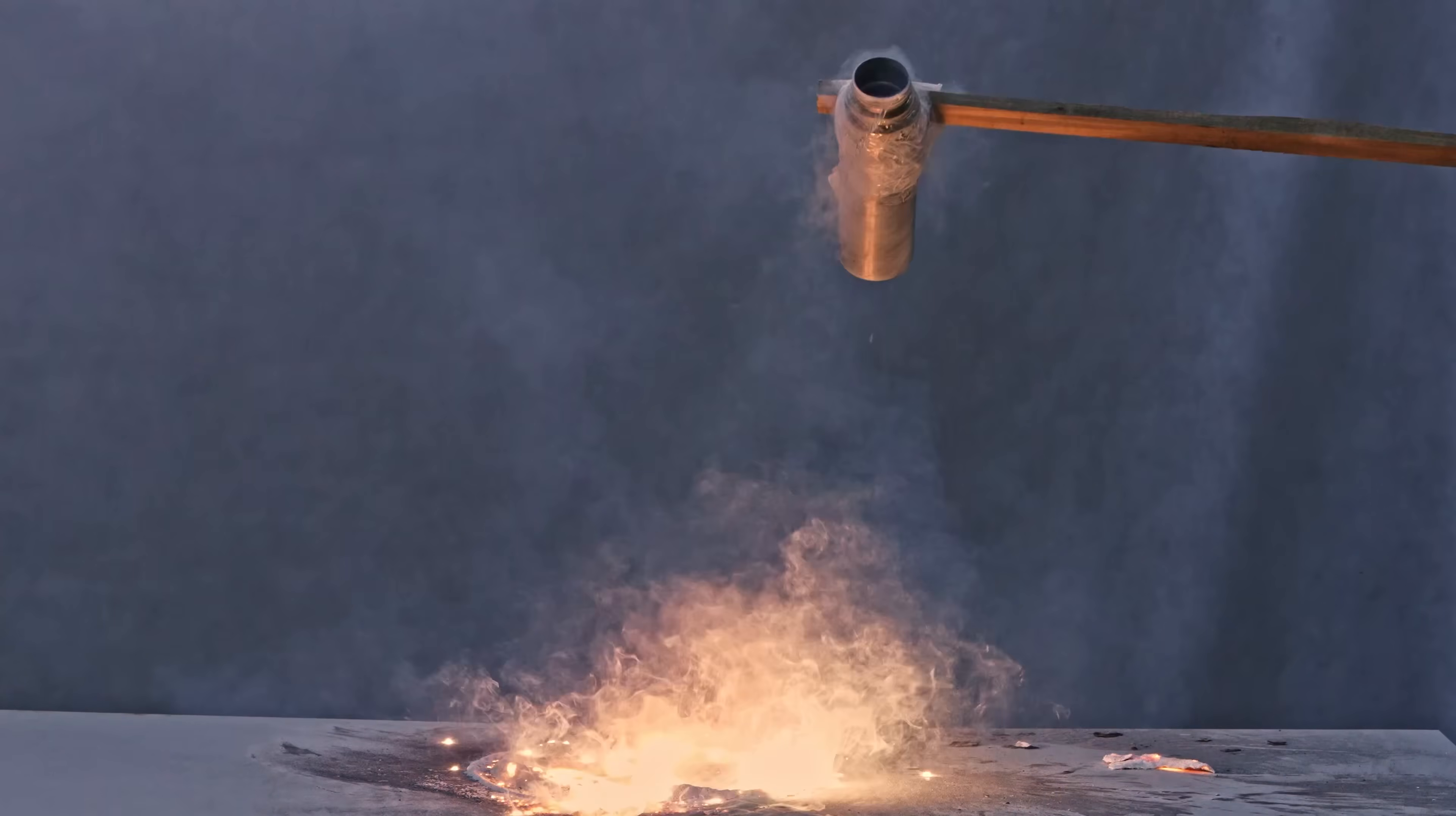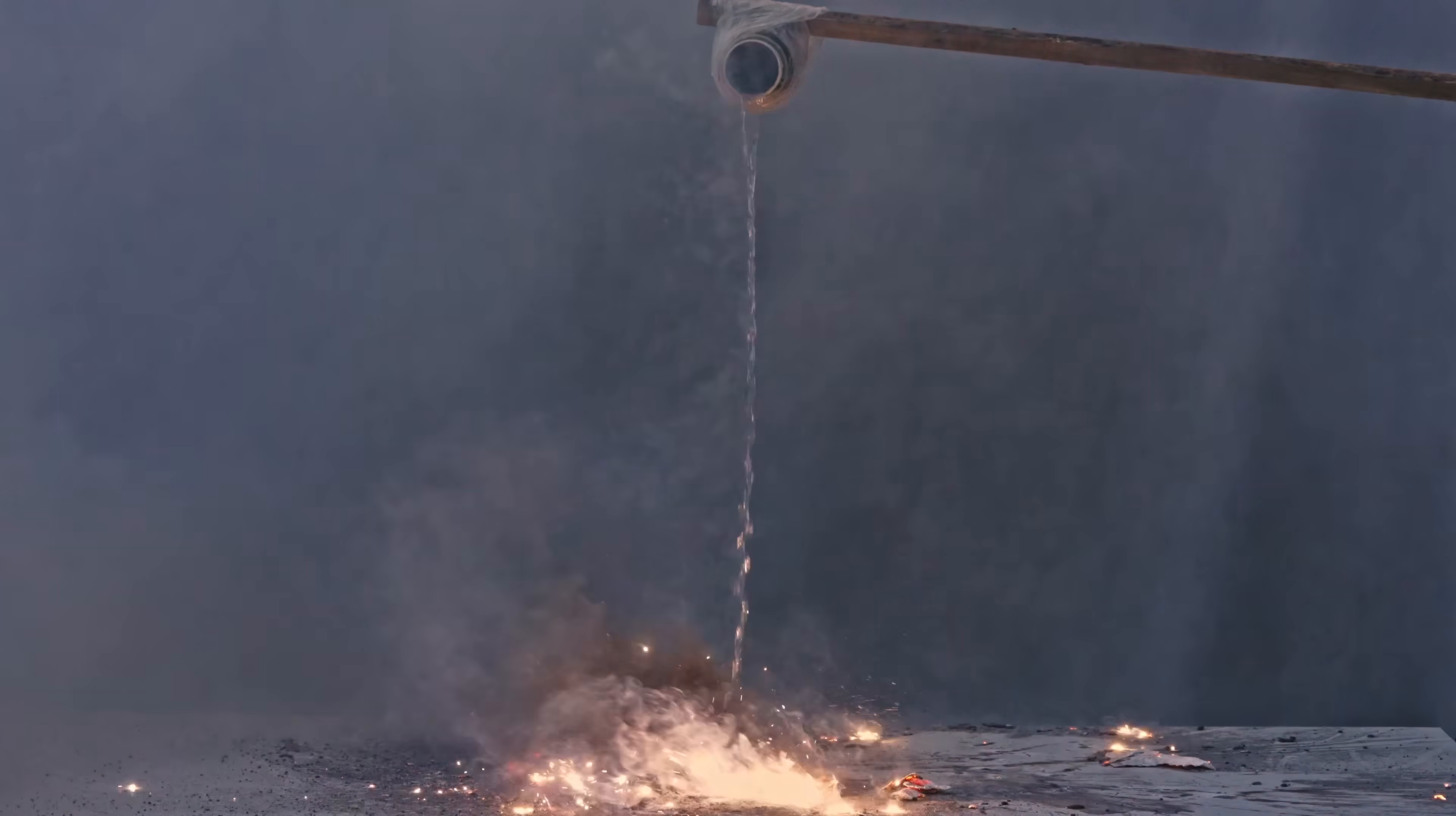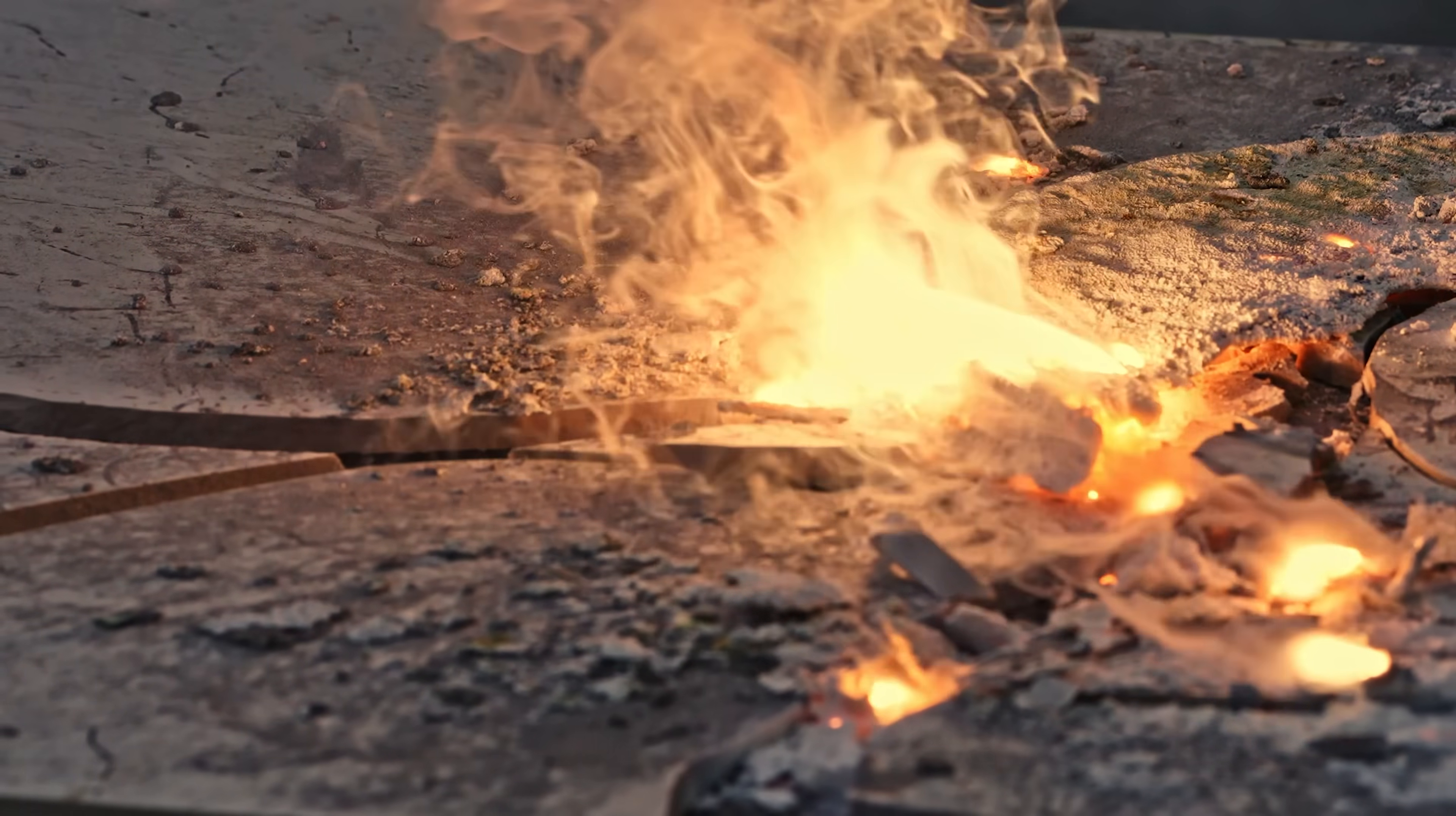As you can see, due to the high temperature, the liquid nitrogen instantly evaporates on contact with the burning magnesium. That's why we can observe large fiery flashes when liquid nitrogen is added to burning magnesium.